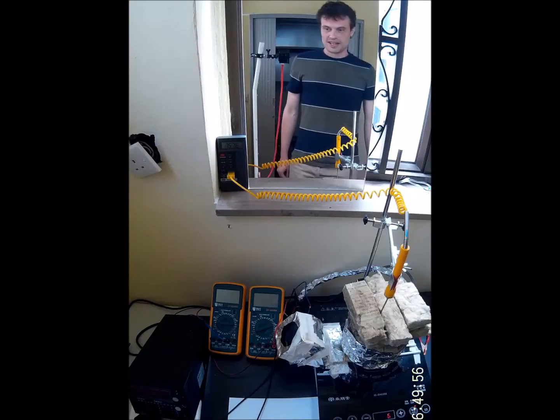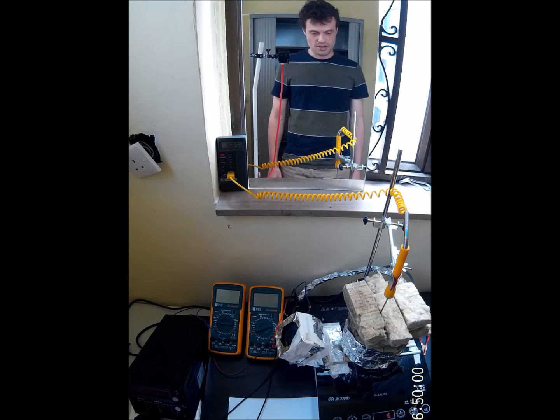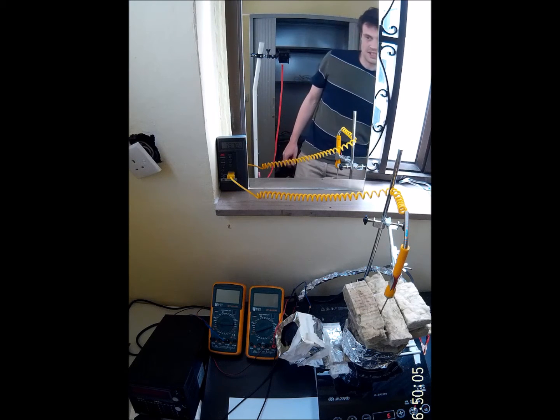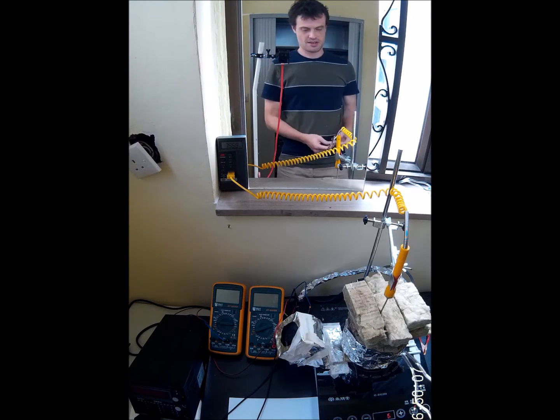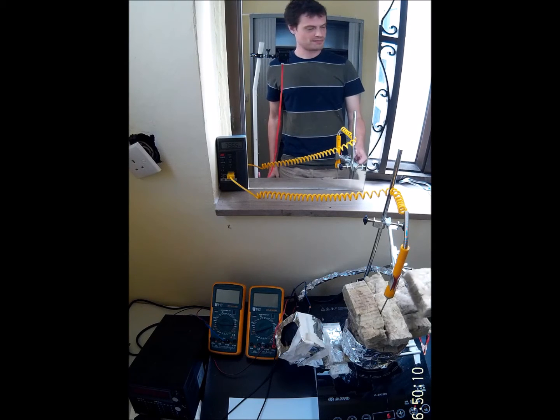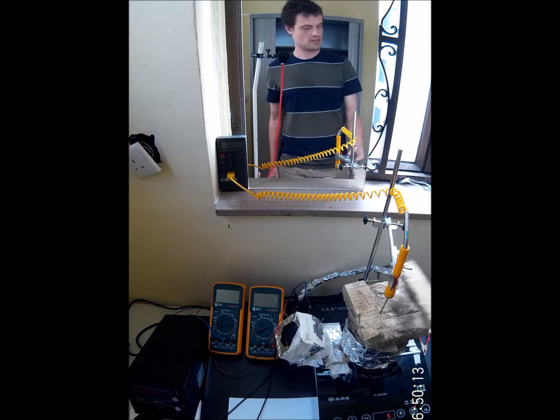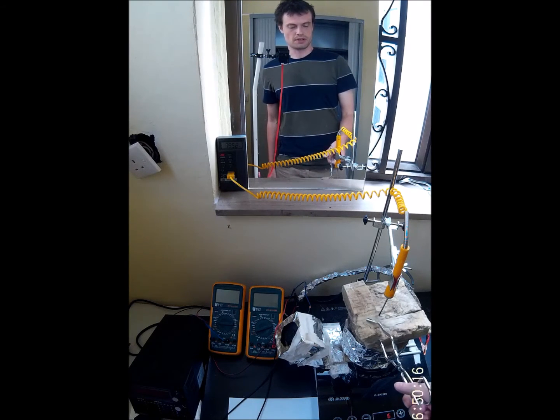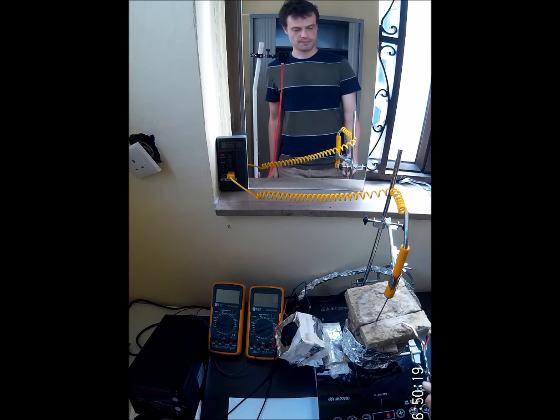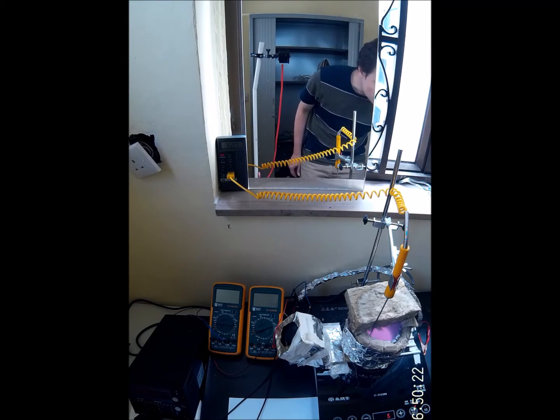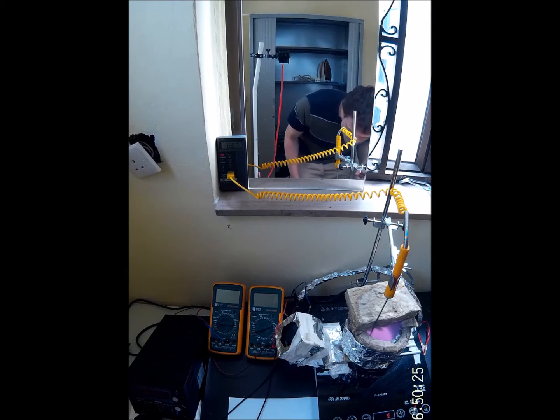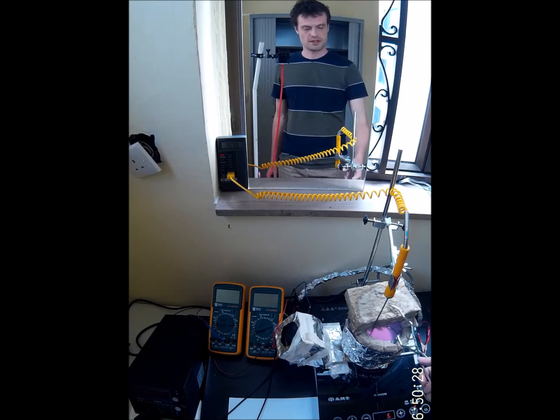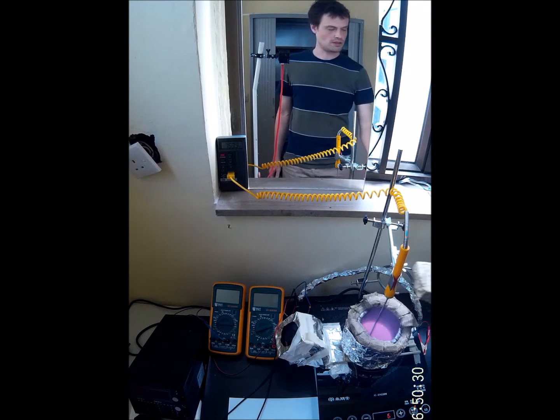Okay, I think it should be molten now. I'm not certain but let's see. At least the temperature is okay, it's just that sometimes it takes some time for everything to melt. Yeah, looks good. I think it's all melted.